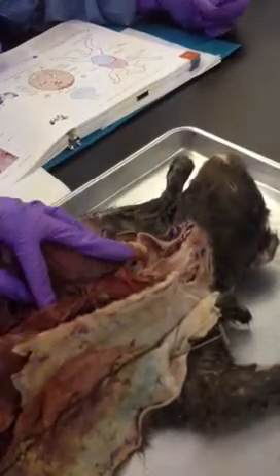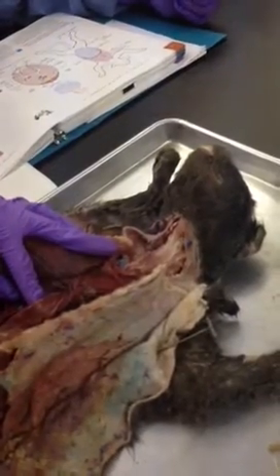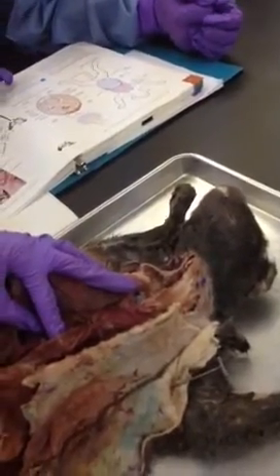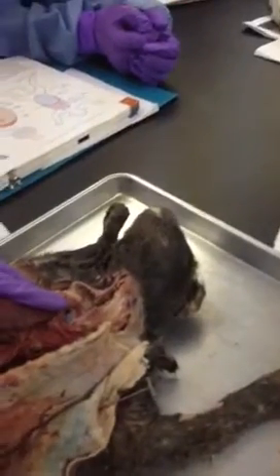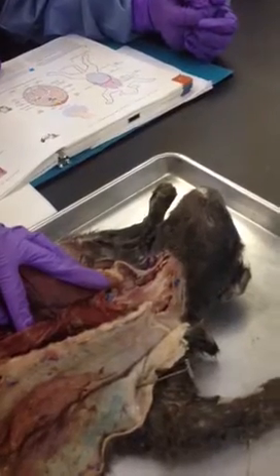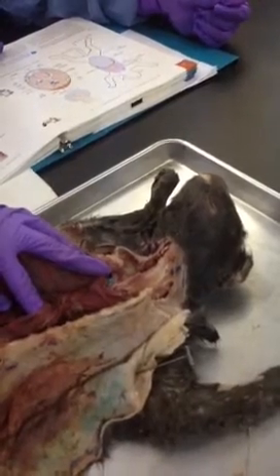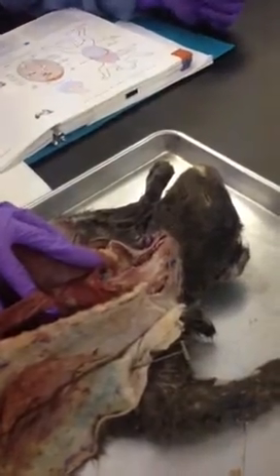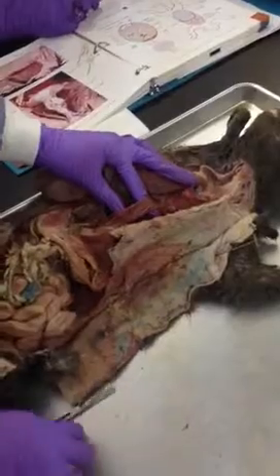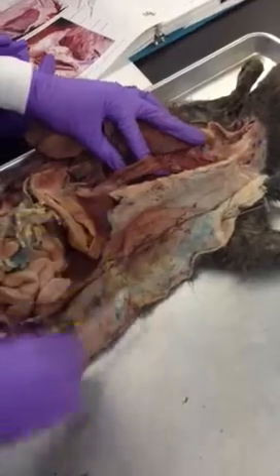I have a nasopharynx, an oropharynx, and a laryngopharynx. That says they're not separate structures. It's just telling you the regional area of the pharynx. So always remember, pharynx means food. PH, food. Larynx, voice box. Voice and breathing. That's how you can separate those. So pharynx empties into the esophagus? Yes, pharynx continues into the esophagus. Once you're in esophagus, it's pretty much the point of no return. When I'm in pharynx, I can still kind of bring it back up. So here's esophagus.